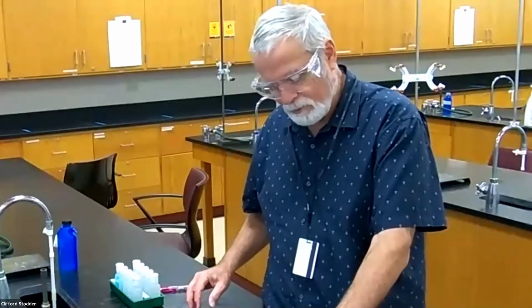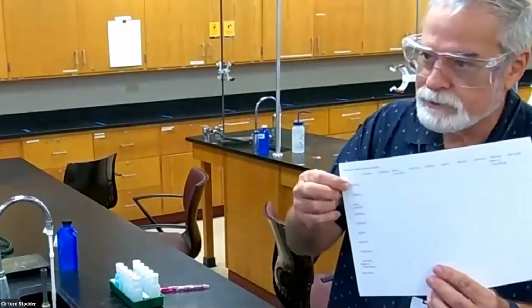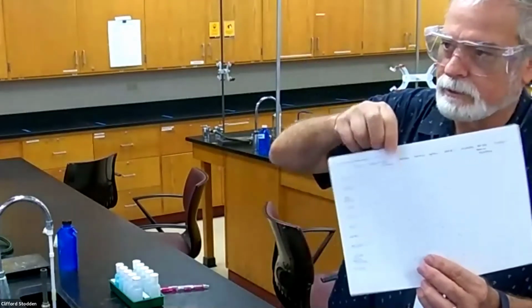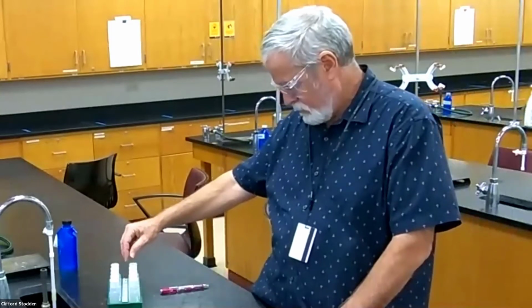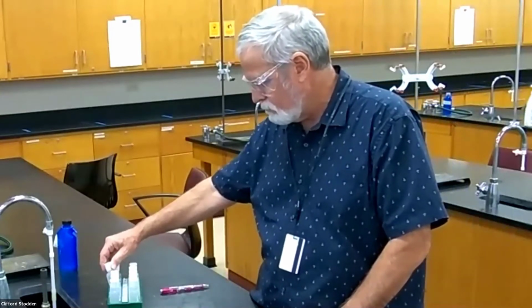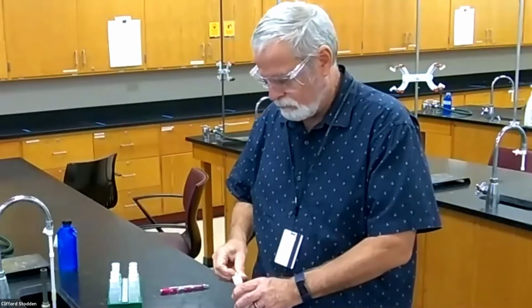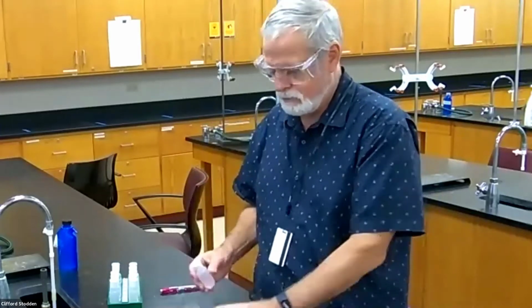First, I might have pointed to the wrong spot here on the first line here. Now we're going to do the barium chloride. So let's see. So I just find my calcium here, calcium, and then I'm going to add it to one of the wells. I'm mixing these things on a well plate. It's just more convenient to do that.